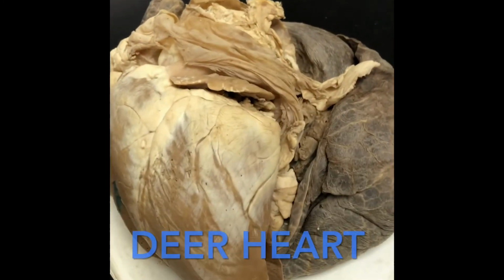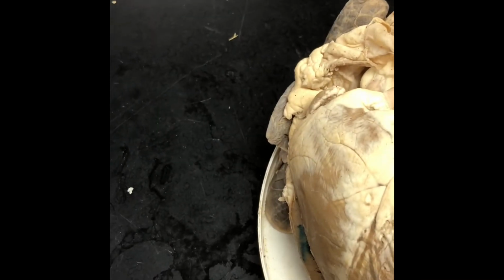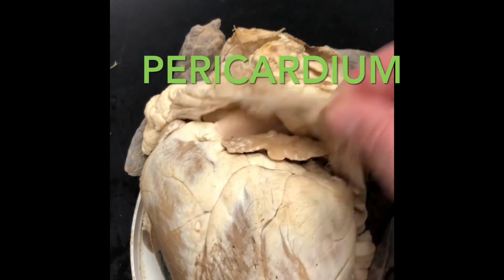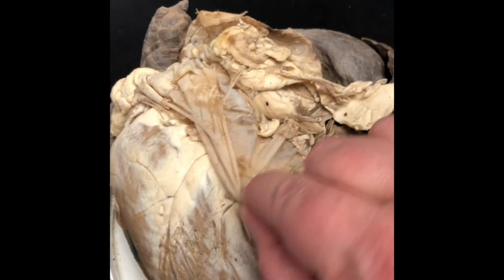Here is a deer heart that I have that we looked at when we looked at the respiratory system. And in here I have, well, this is the pericardium, so the sac that covers the heart. It's a little small now. It doesn't come down very far.